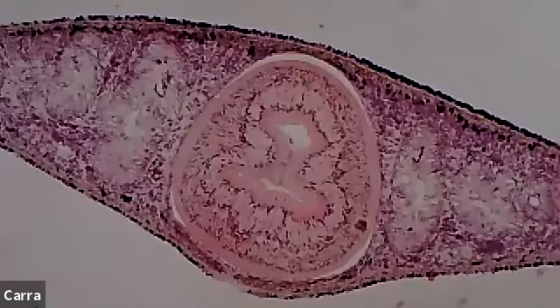And what you'll see is that it has all of the different three layers that we think of with the body, the three dermal layers. So the pharynx itself, that circular thing in the middle, is going to have the endoderm, which is that squiggly middle part that has the kind of cavities that you can see in it. And then the part in the middle is the mesoderm, so that's the muscular part. And then the ectoderm is that outer layer or the outer circumference of the circle.